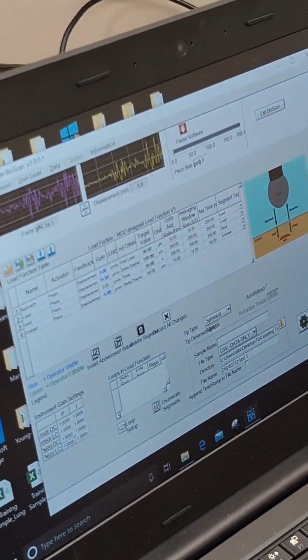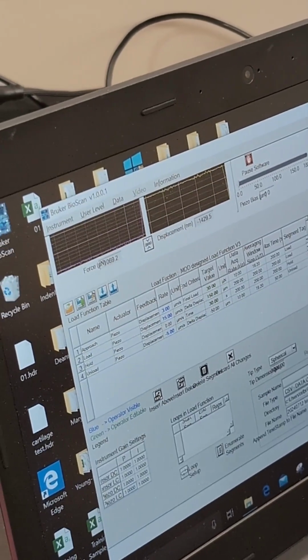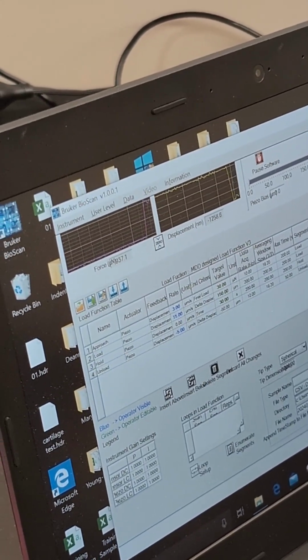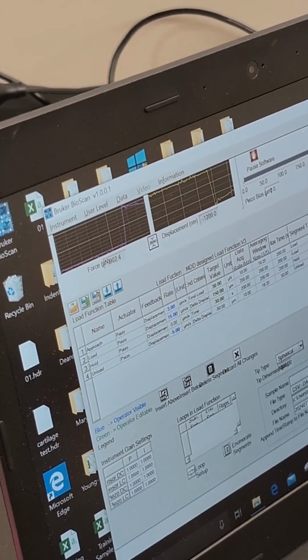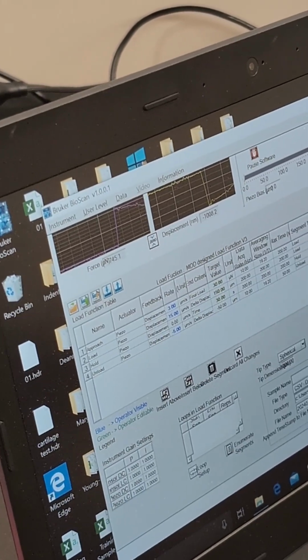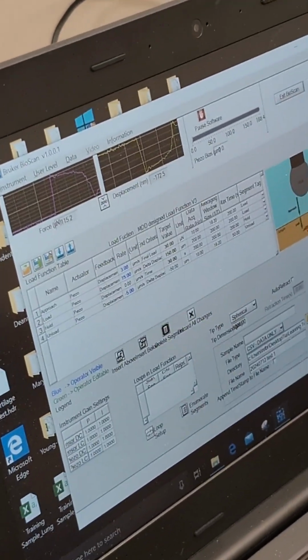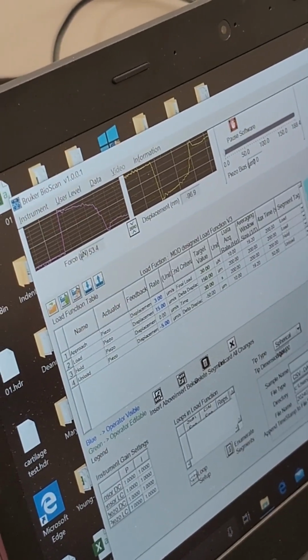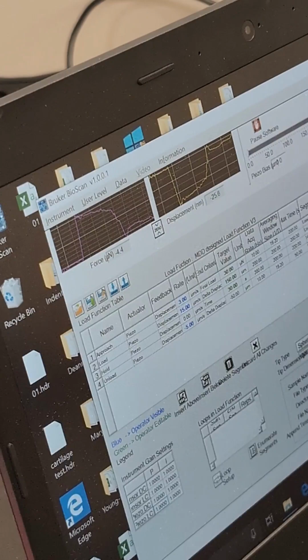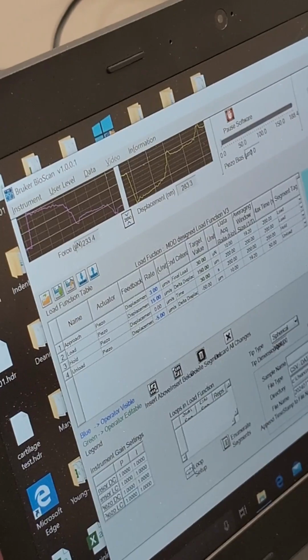So keep going down a little bit. This is where you have to rely on sort of a feeling. Oh, now it's in full contact with it. So now it shows the force to be 800, 900. So that's the equivalent of actually hitting the hydrogel, so it starts to release the energy. Okay, almost. So now it's negative 200.